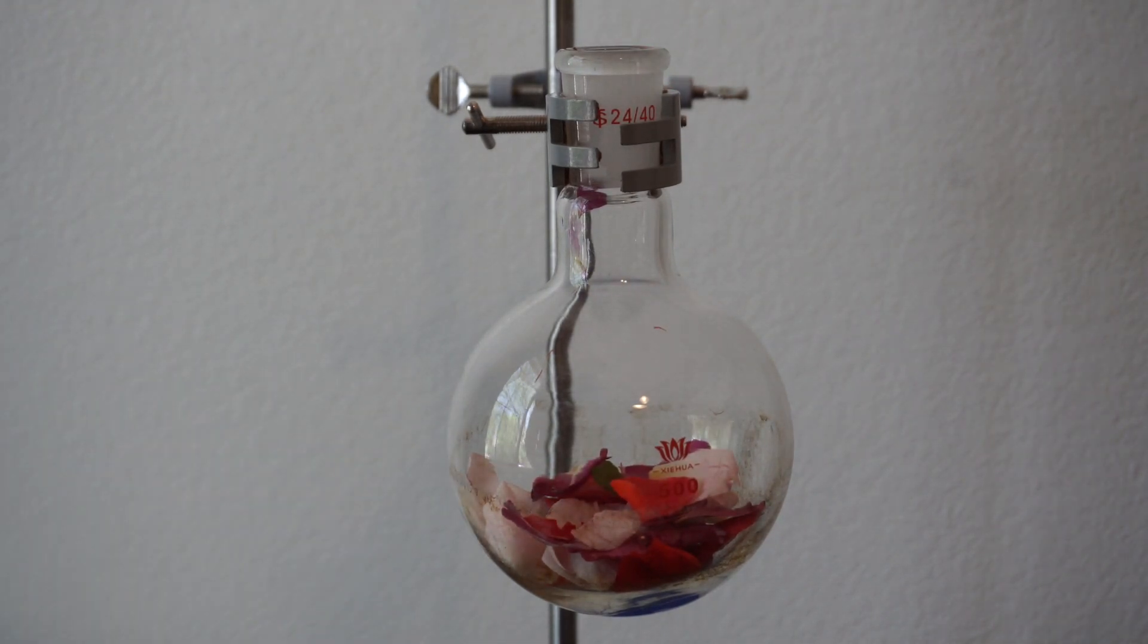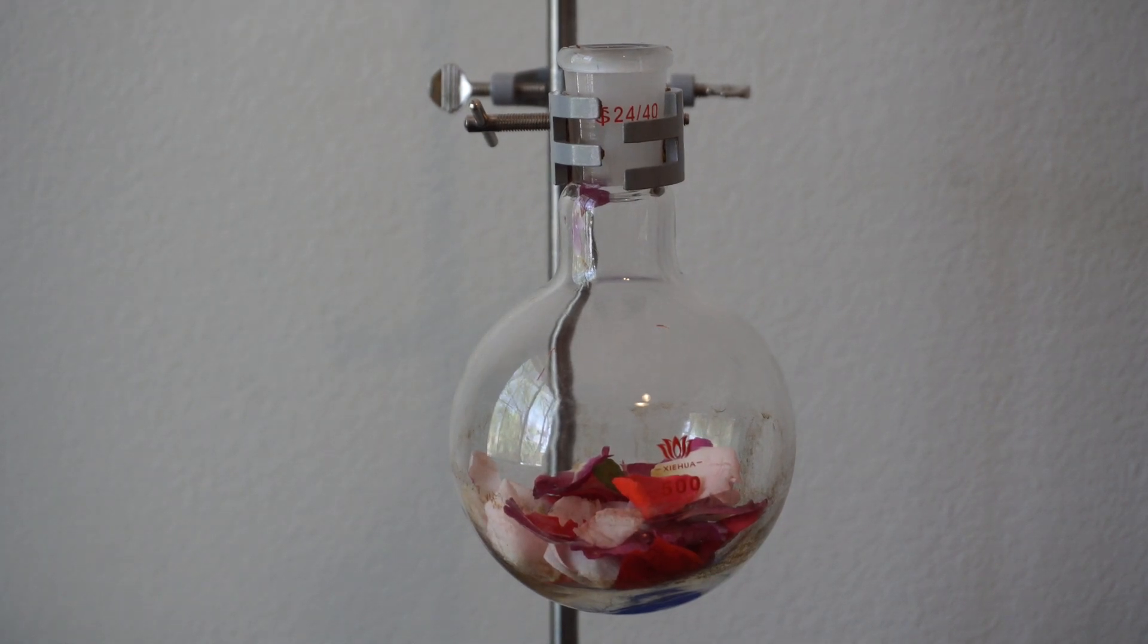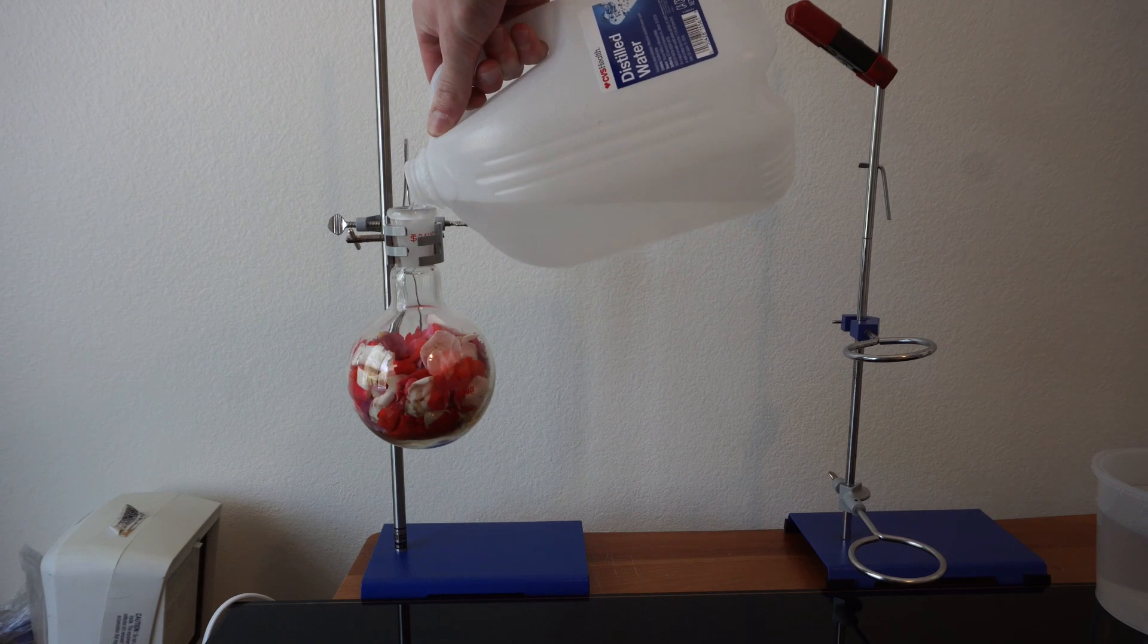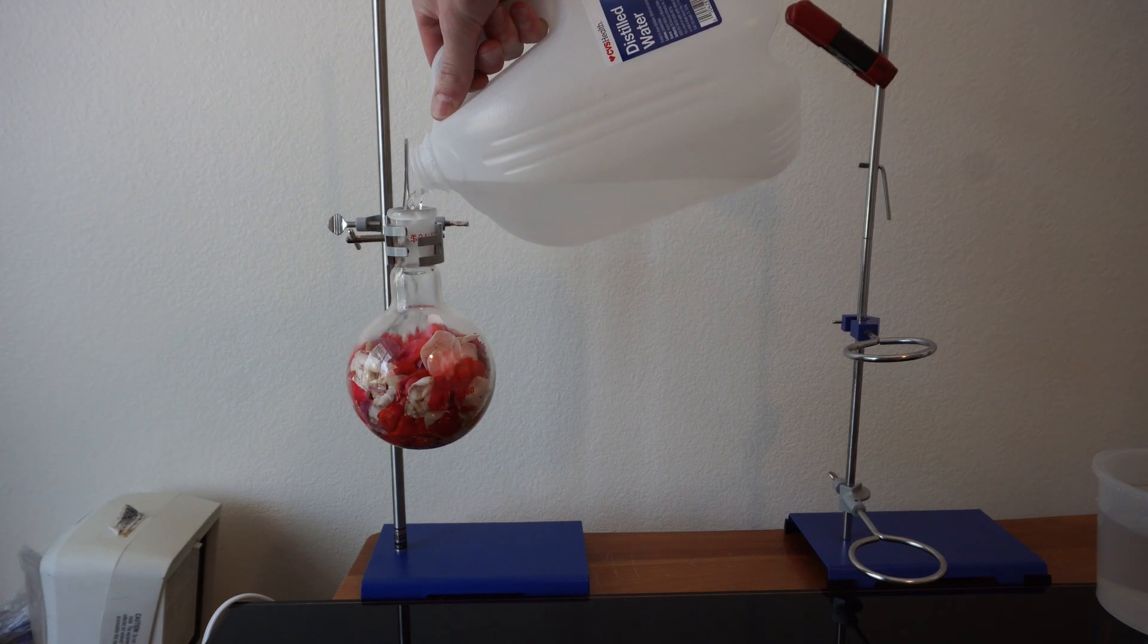Something interesting to note, though, is roses produce much less oils than other plants, so a larger amount of them is used. I think the actual ratio is like 5,000 kilograms to one liter of pure oil, but I might be wrong.